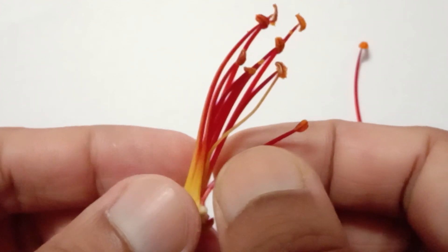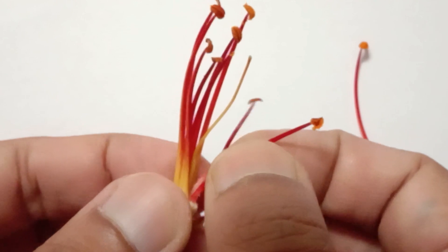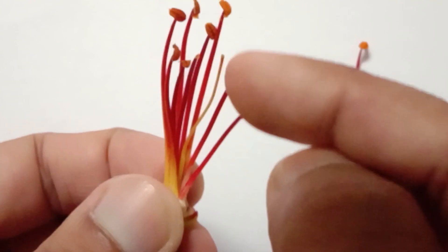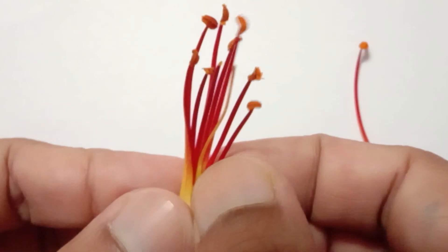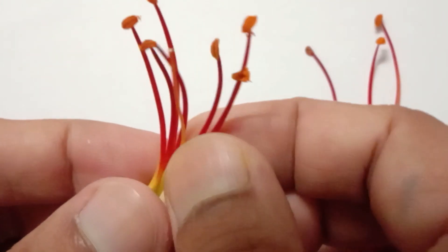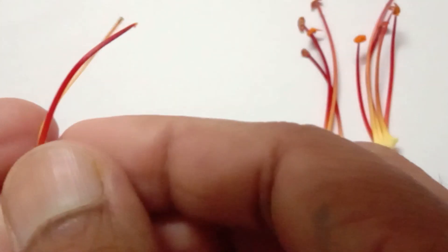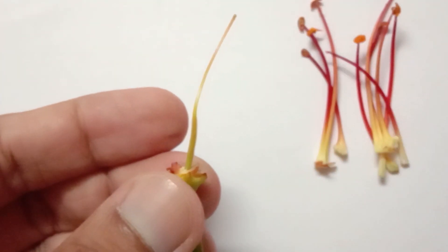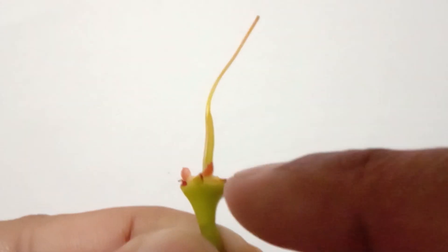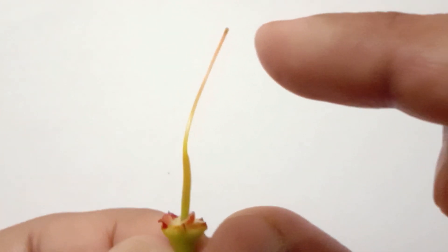There are 10 such stamens in each gulmohar flower. There is only one single female reproductive part, which occupies the central place with no separate head, and all the male parts surround the female part. Now let me detach all the stamens. This is the entire female reproductive part, referred to as pistil.